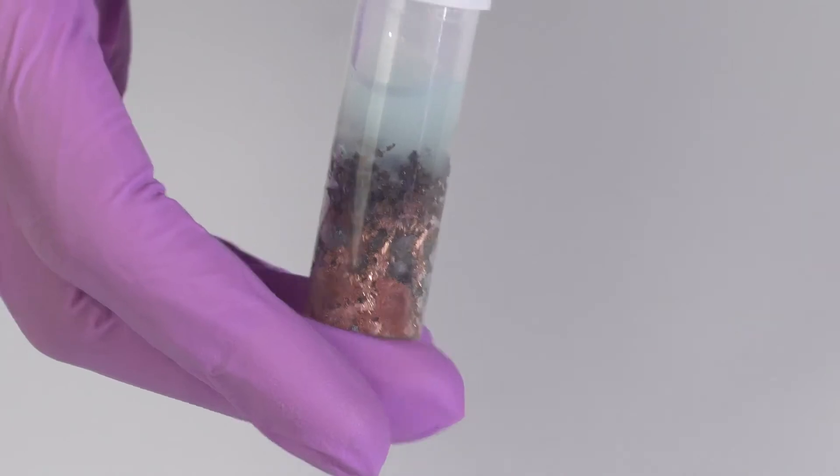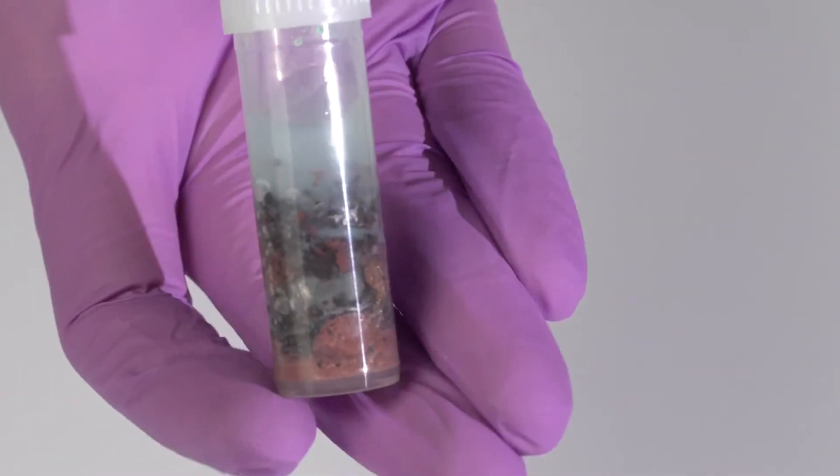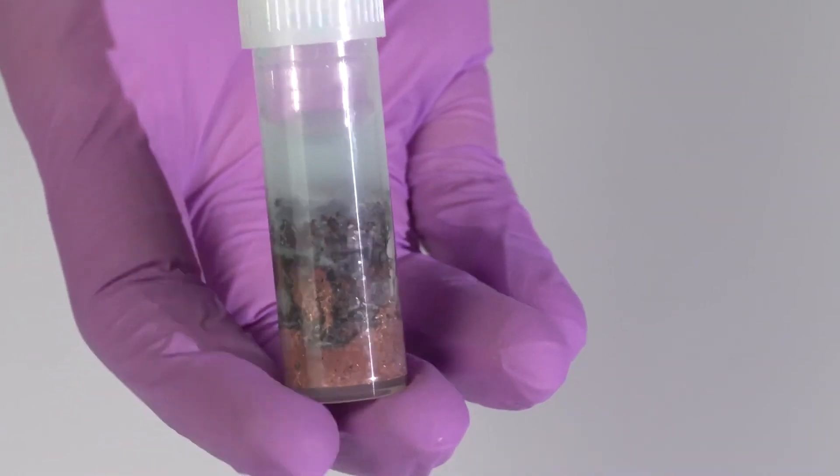Now, wait 24 hours. Zinc reacts with copper sulfate, which results in the growth of crystalline copper.